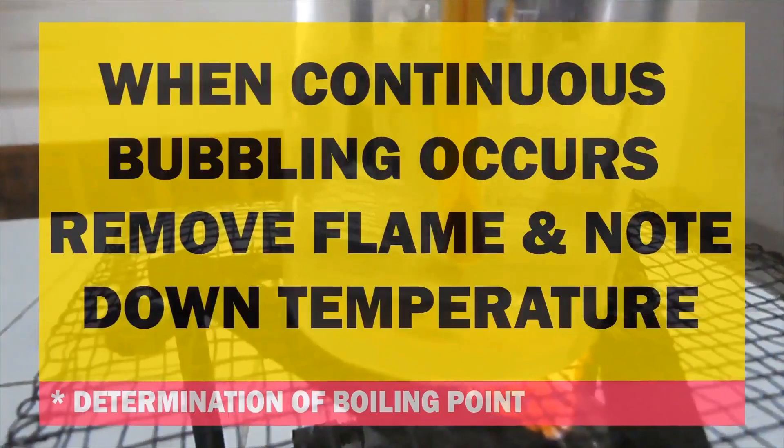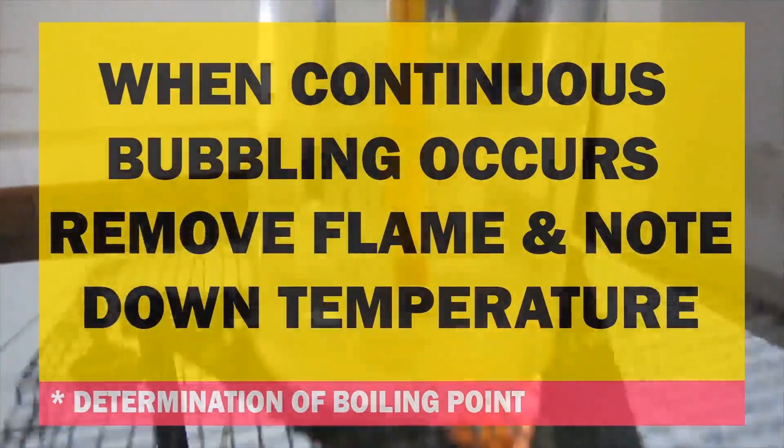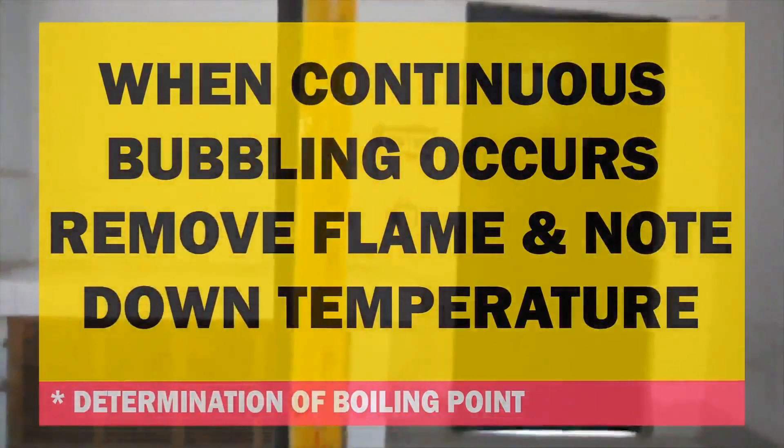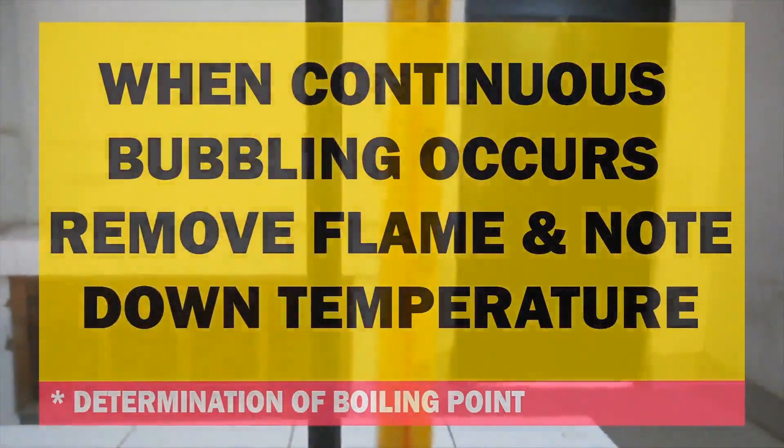When continuous bubbling occurs from the lower end of capillary tube, remove the flame and note down the temperature.